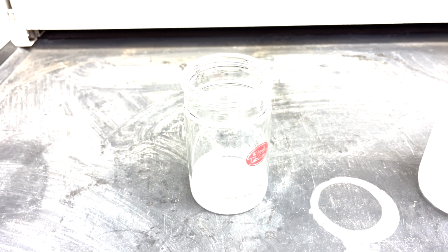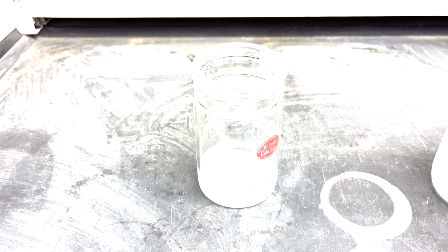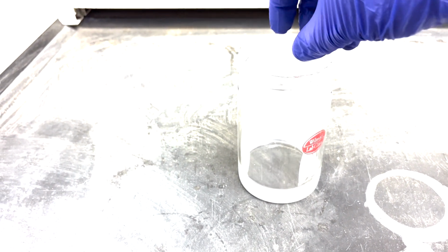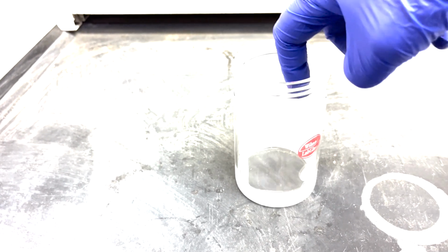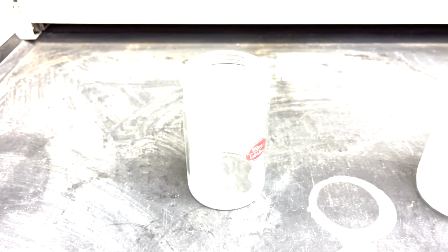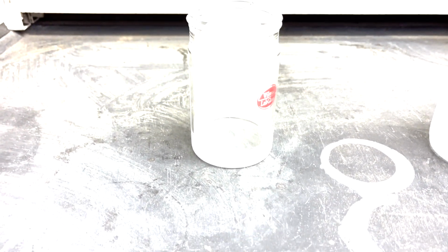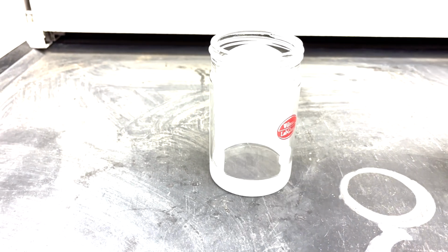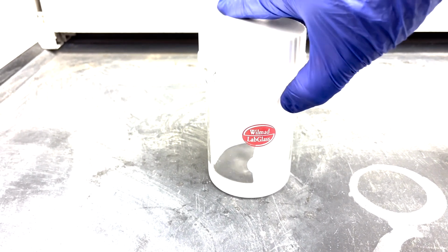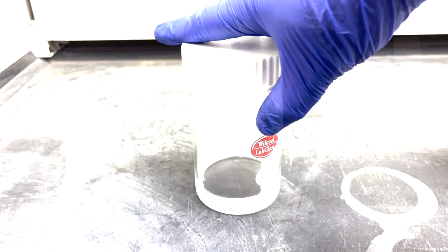In these types of chambers, I like to cut a piece of filter paper and sort of circle it around itself, and then insert that into the chamber and allow it to sit on the back wall. Now notice I've shown you two types of chambers. Those are the most common. Notice what I haven't shown you is a setup that you may have used before, where you just set a watchglass on top of a beaker. That's not really sufficient. You need a nice TLC chamber that has a really good seal. So you can't just set something on top of a beaker. You need a tightly sealing, proper TLC chamber.